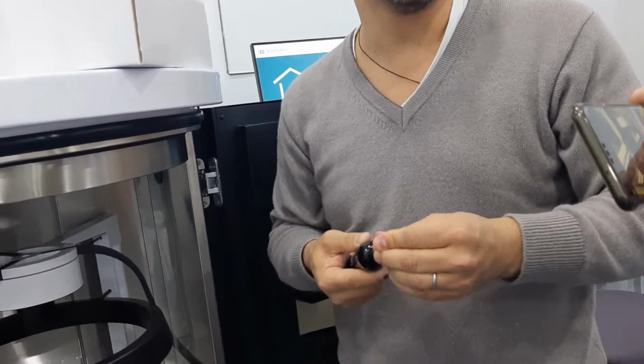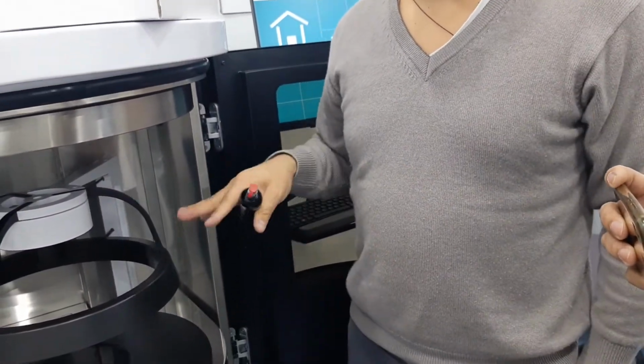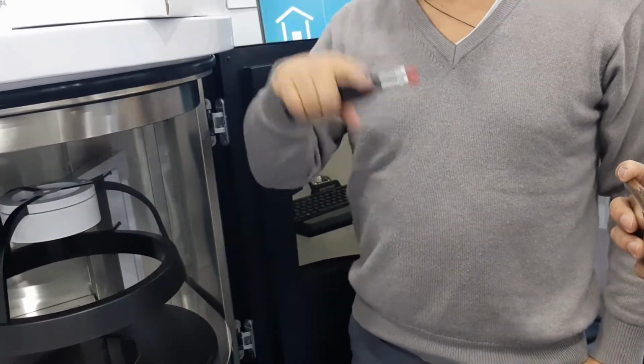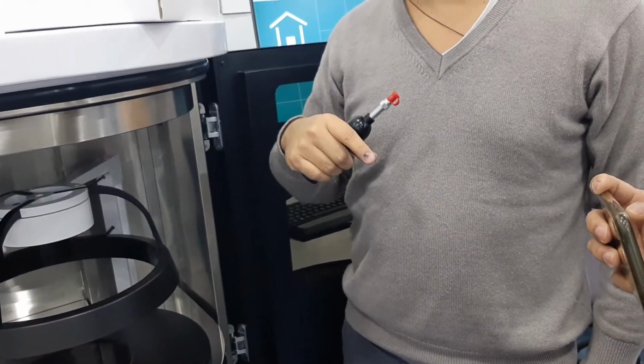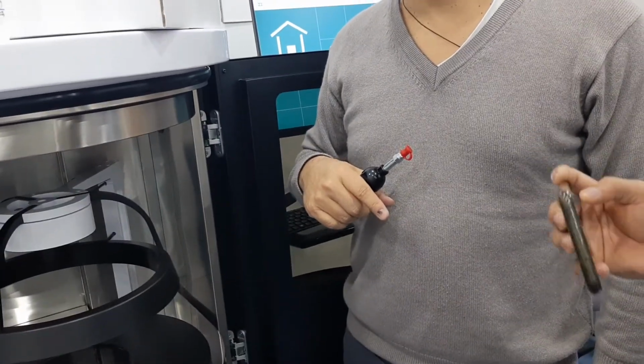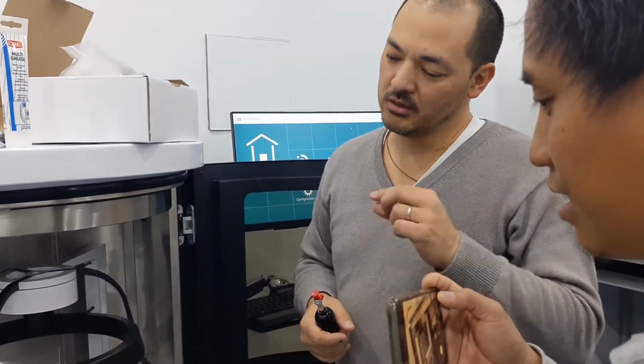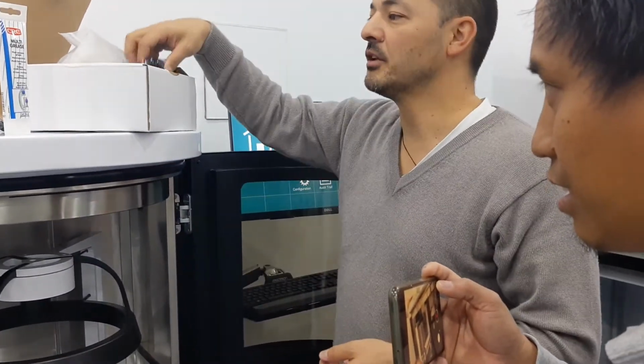Anyway, this is quite difficult. But I mean, you should grease it every 6,000 meters. 6 kilometers. Yeah. So every year. I mean, if you don't do it, it's okay. It's better. If you don't do it, the risk is that the ball bearing maybe becomes a bit squeaky, makes a bit of noise. So it's better to do it.